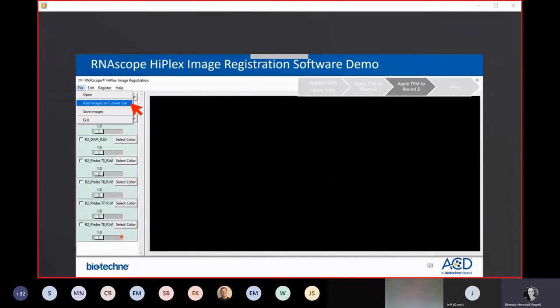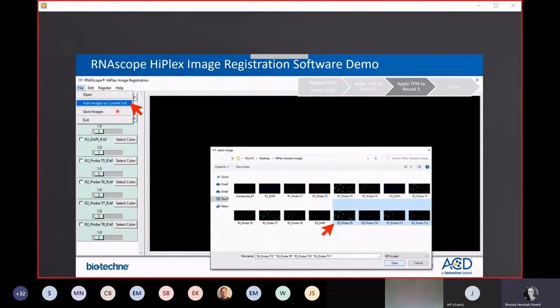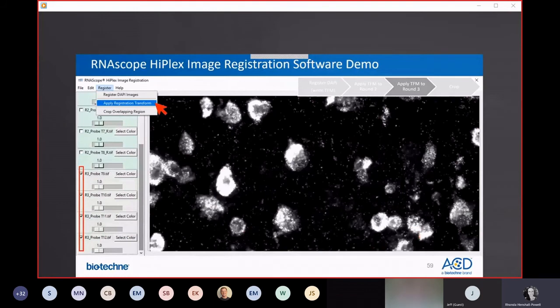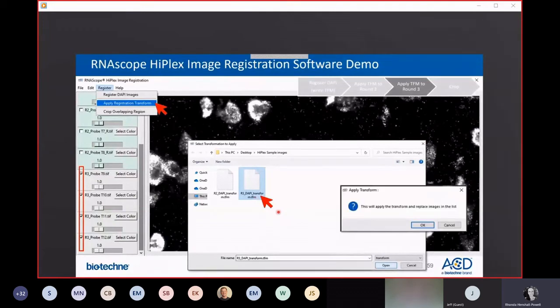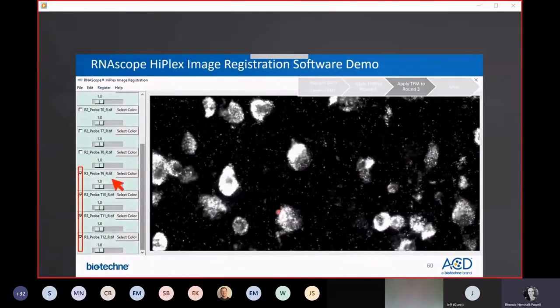And then you just repeat that process to overlay the images from round 3 onto round 1. So again, going up to the File menu, Add Images to Current List, select your channels from round 3. So now this is probe T9, T10, T11, and T12. Add them to your dashboard, apply Registration Transform, select the transformation matrix that was written originally by registering round 3 DAPI to round 1 DAPI, and hit OK. At which point, these are replaced with green, highlighted, R_ files, indicating that they've been registered now and aligned to round 1.